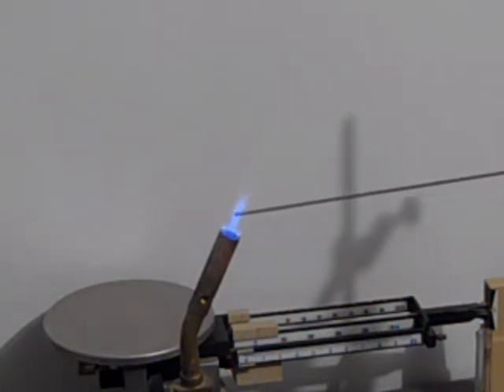There it is. See the yellow-green? I'll do it once more for you. This is barium.